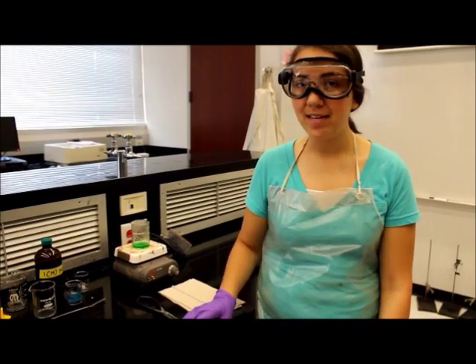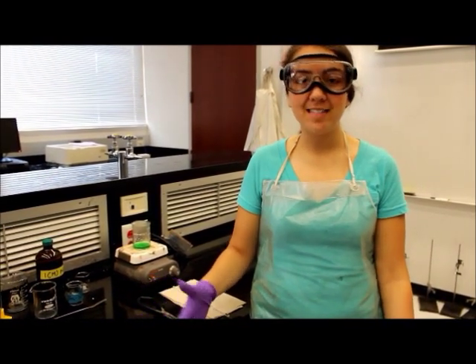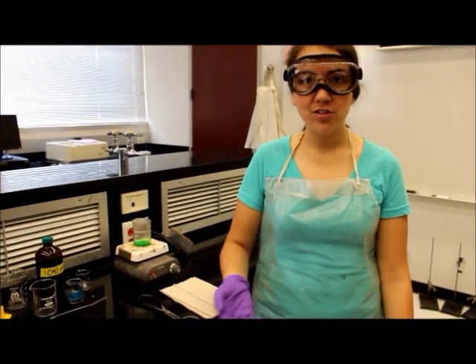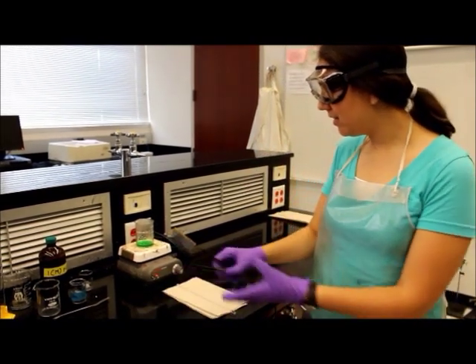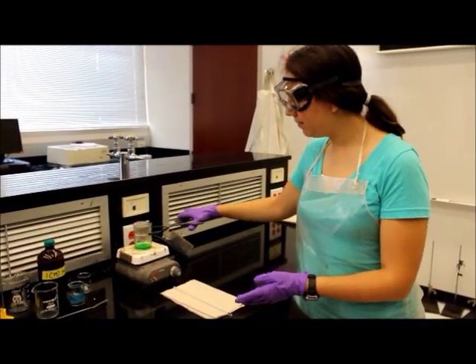So for this experiment, you will be determining the empirical formula for copper oxide. It's really important for your entire lab grade that you get as accurate a result as possible. And one way to ensure that you get an accurate result is to heat the copper correctly.